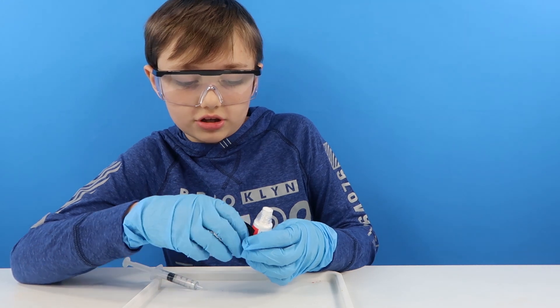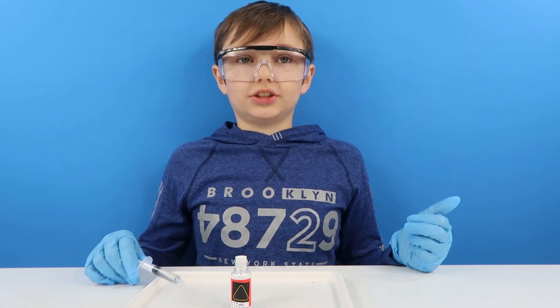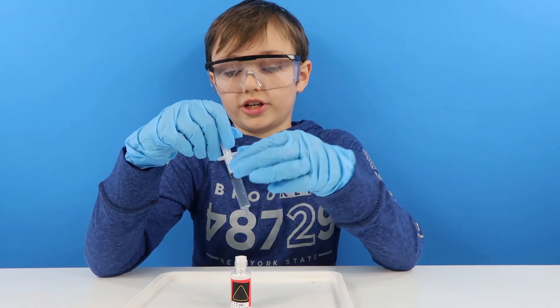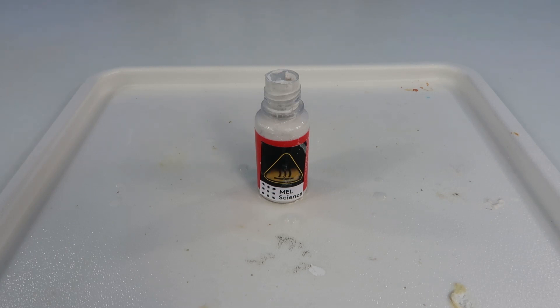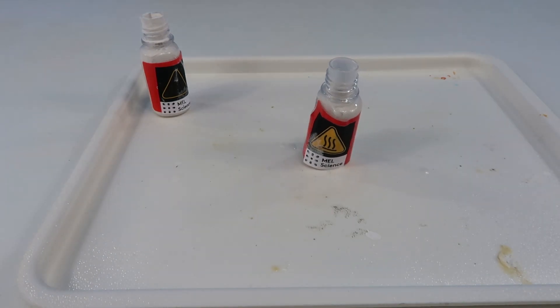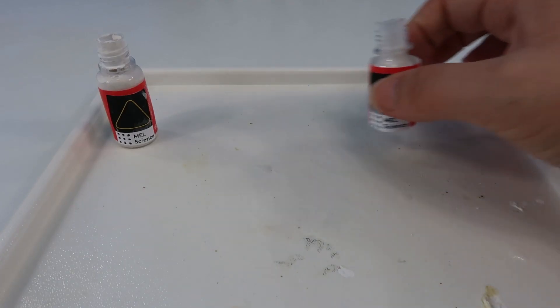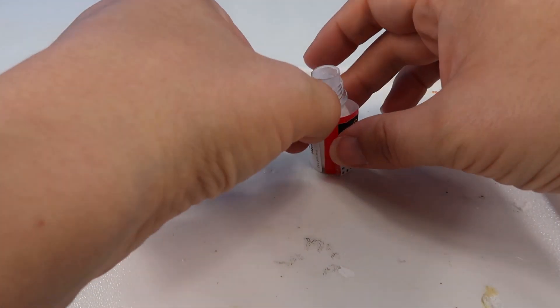Basically it's not called calcium oxide, it's called danger! Okay, and then what we need to do — this is basically the last part of the experiment, guys — we just need to put some water in, two mil of water actually. Let's see — that's still boiling hot! That worked really well, didn't it?